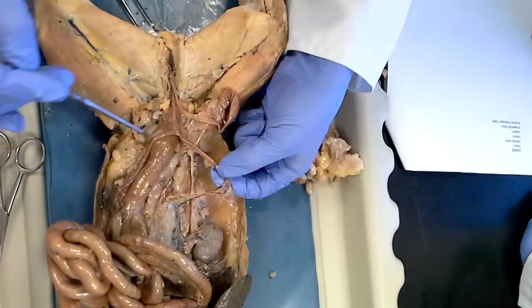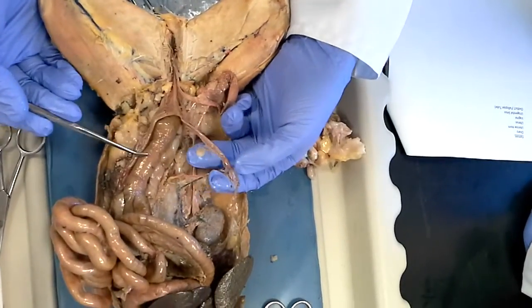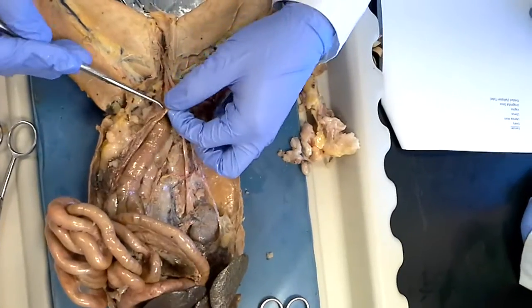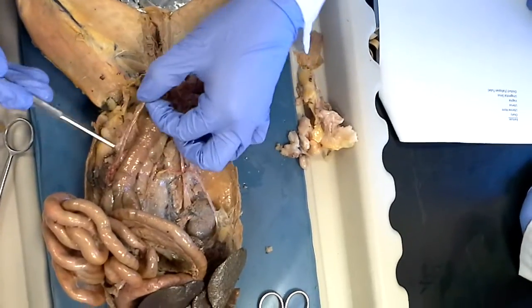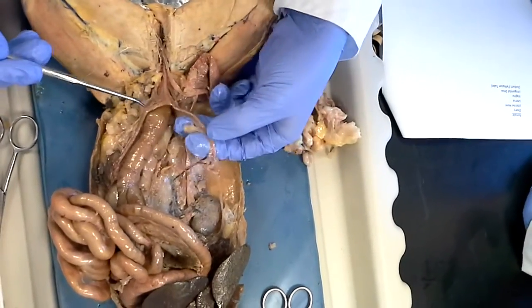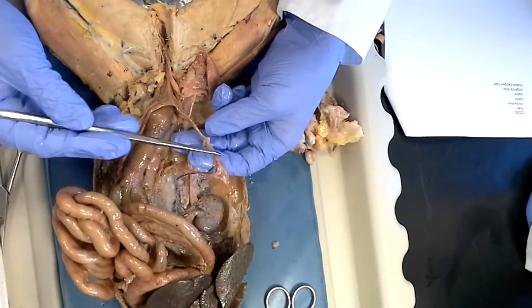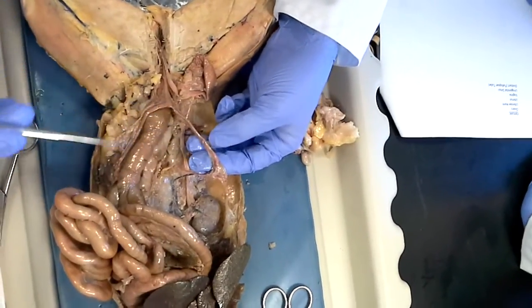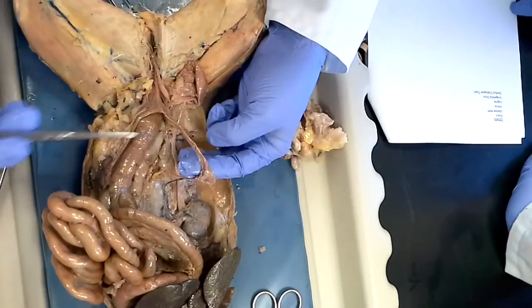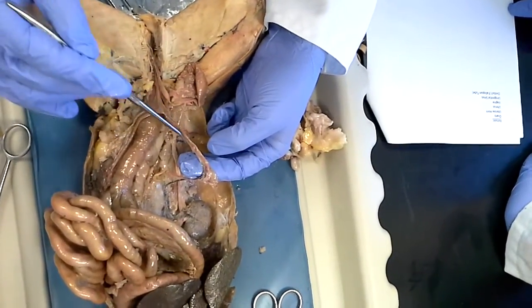Now we're going to do the reproductive structures. A cat, just like a lot of mammals, can have a litter of offspring at a time, so they need a much larger uterus allowing for multiple spots for implantation.